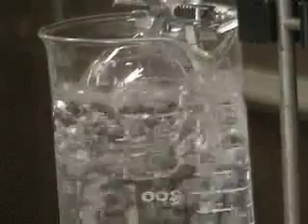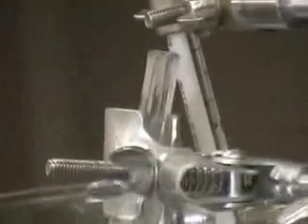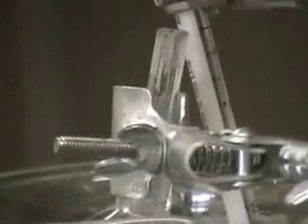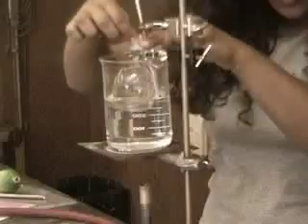After we see all the volatile liquid has evaporated, we allow it to keep heating. As the vaporized liquid goes up the tube, we can see it cooling and turning back to a liquid. We must continue heating until we're sure that there is no liquid remaining in the flask. We heat for a couple extra minutes to be sure there is no liquid left.